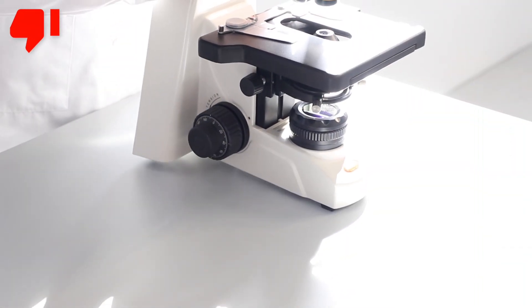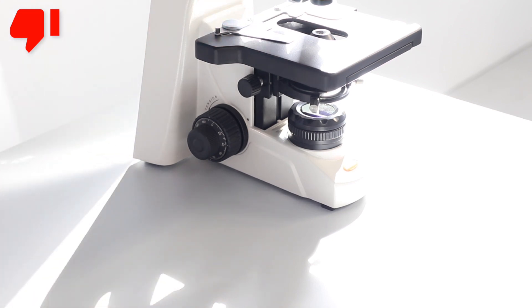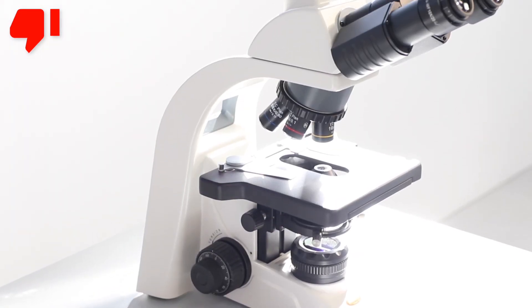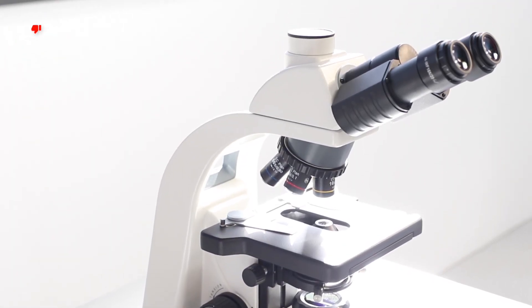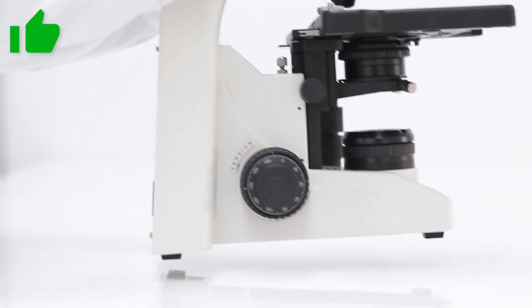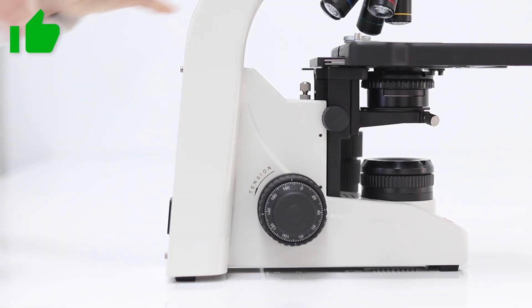Avoid placing the unit in locations exposed to direct sunlight, dust, vibration, high temperature or humidity. Place it on a clean, stable and flat surface. Also, ensure that it is located where it is less likely to unplug the power supply cord.